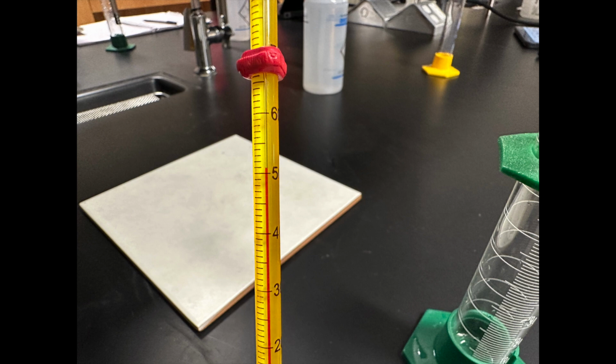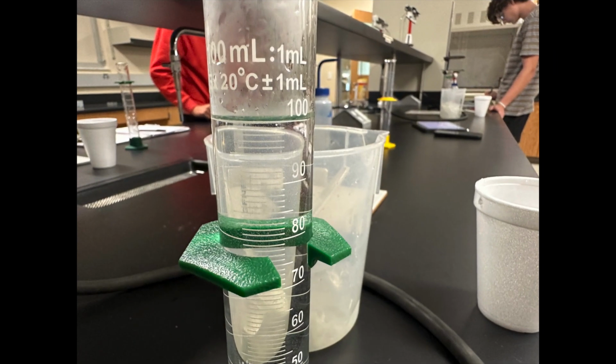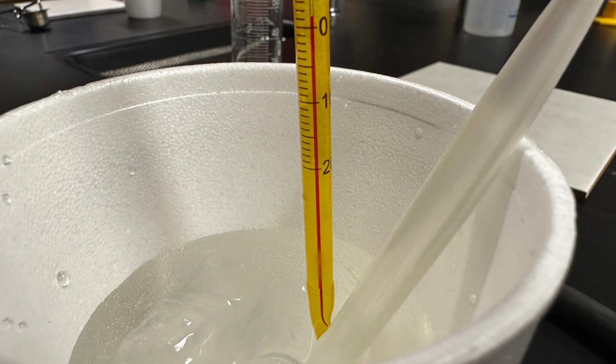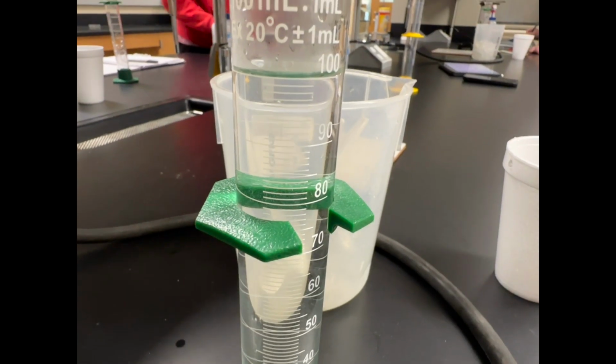And then we're going to begin adding ice. We're going to add a lot of ice early to cool it down quickly and get an accurate reading. We'll remove any leftover ice once the temperature reaches as close to 0 as possible. Here we've got just about 1 degree Celsius.